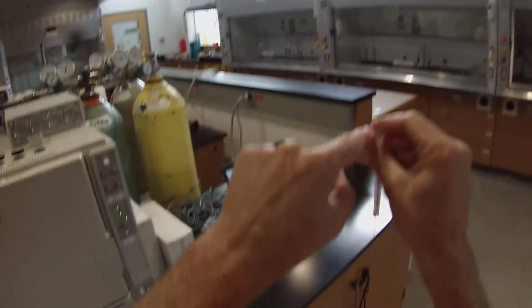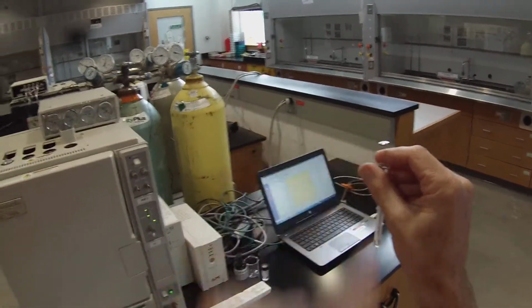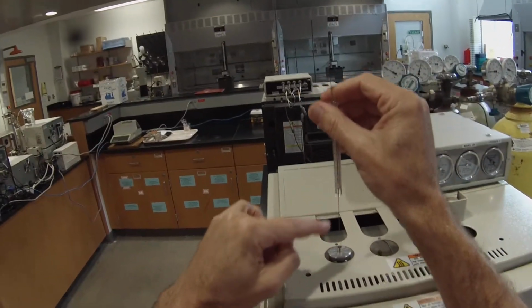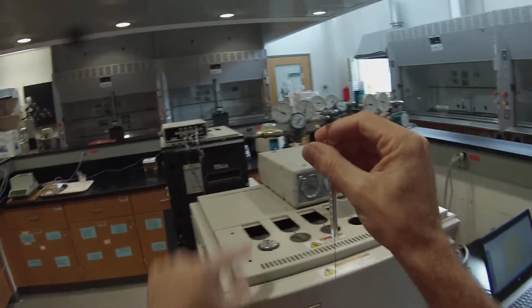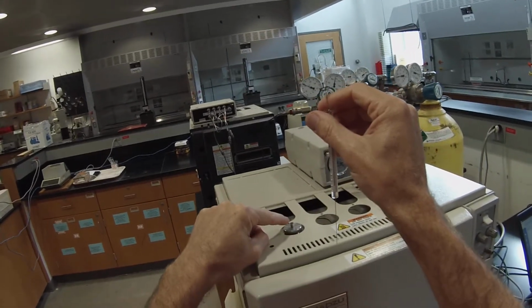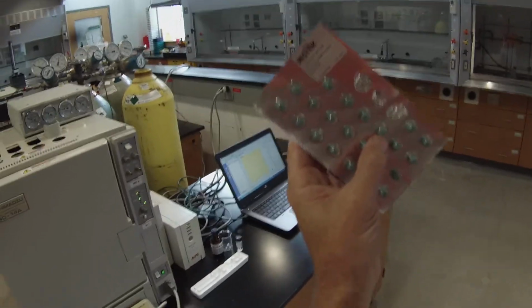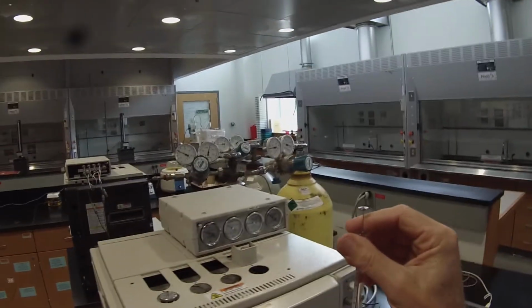So I'm applying a little lateral pressure here to make sure that the plunger doesn't pop, because when I put that in there, it's under 90 kilopascals pressure. It's going to try to blow the plunger up. What I need to do is insert the syringe all the way down in so the tip is in the injection port, so that the glass is just on top there. It's going through a rubber septum, which looks like this. It's one of these little green septa. So there's going to be some resistance, but if I have it going in at the wrong angle, then it'll hit metal and that'll bend the needle.